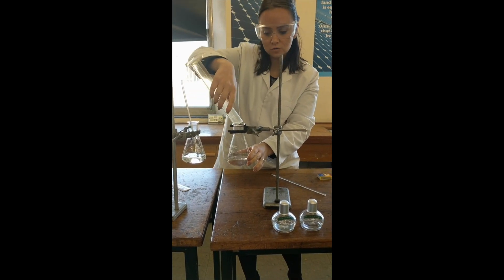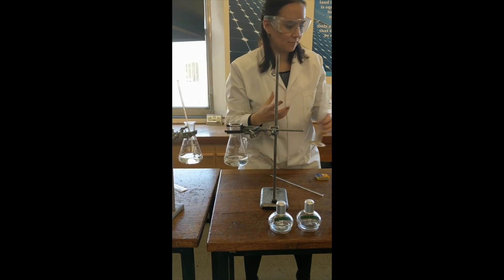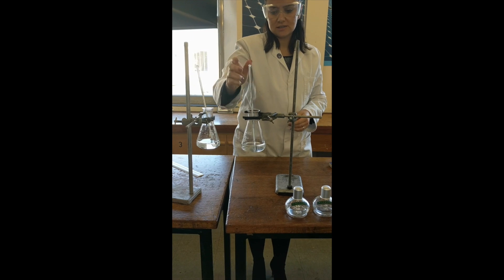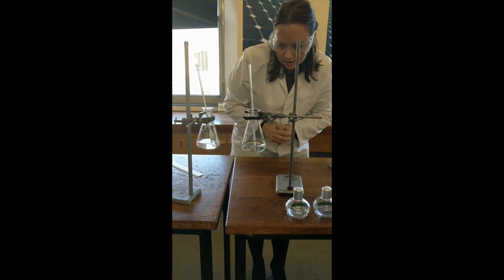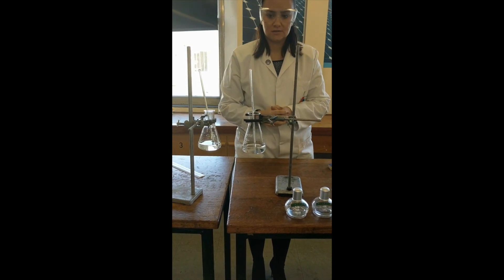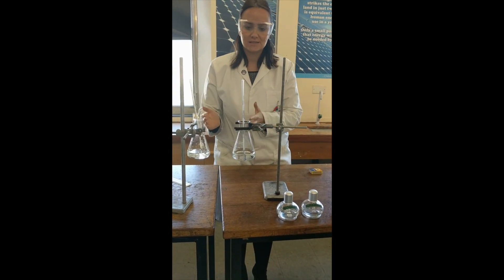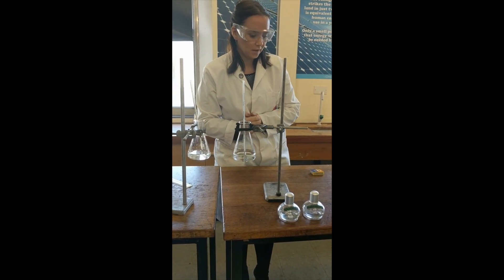This has got to be cold water fresh from the tap because we're going to be heating it up. And you will then need to measure the starting temperature which is reading at 21 degrees Celsius. And we'll record that into a table. We need to know the starting temperature so we can see how much it has increased by.